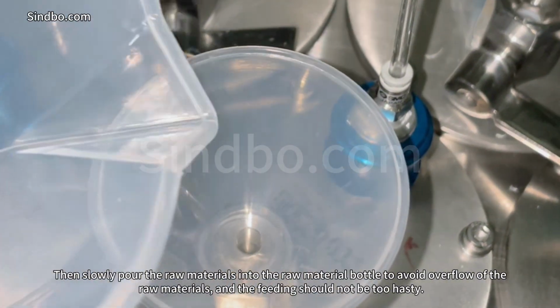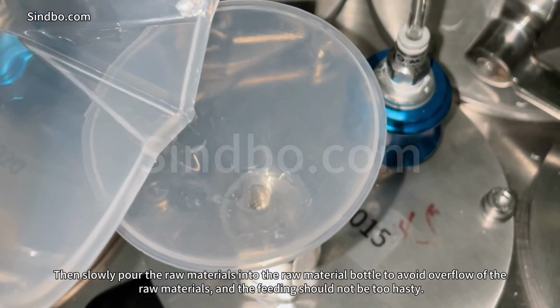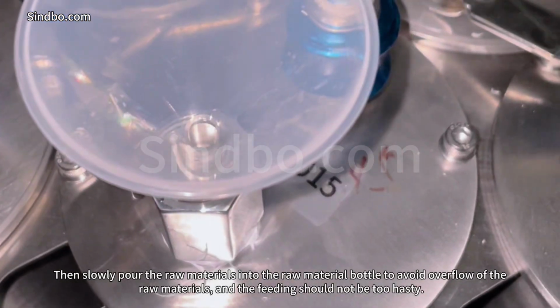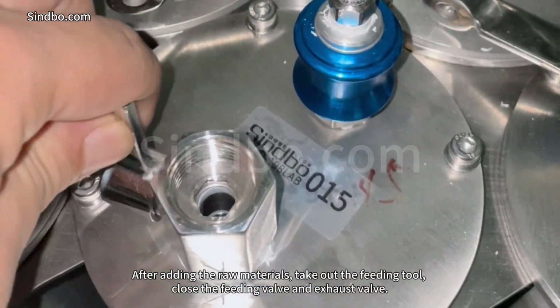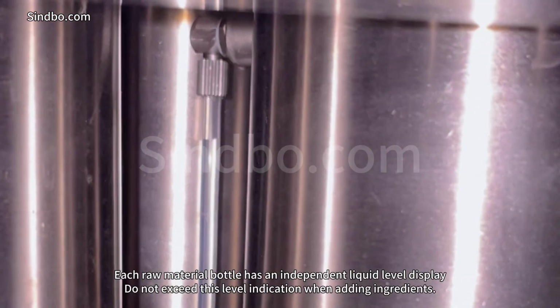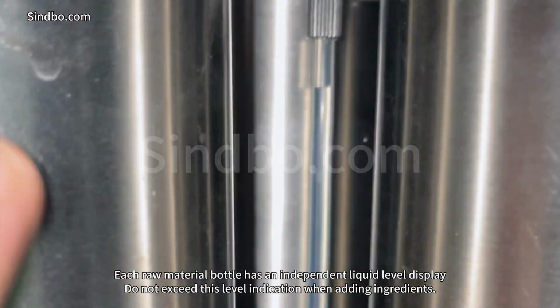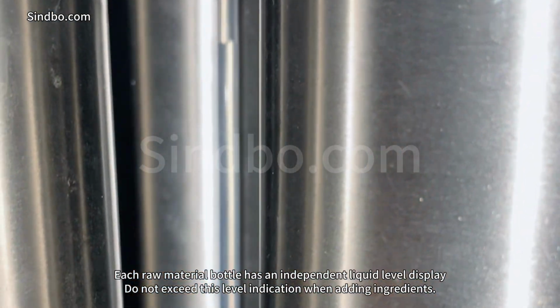Then slowly pour the raw materials into the raw material bottle to avoid overflow of the raw materials, and the feeding should not be too hasty. After adding the raw materials, take out the feeding tool, close the feeding valve and exhaust valve. Each raw material bottle has an independent liquid level display. Do not exceed this level indication when adding ingredients.